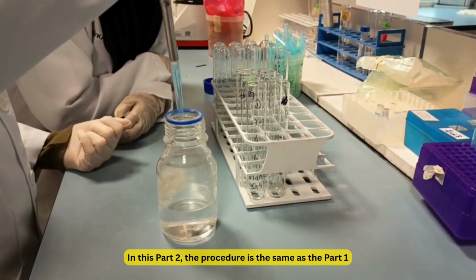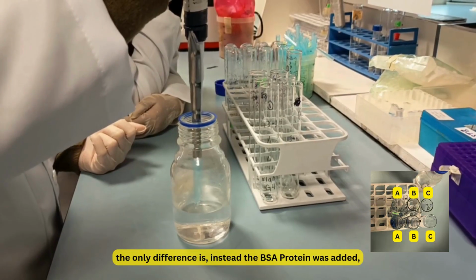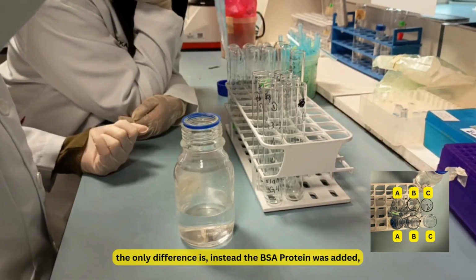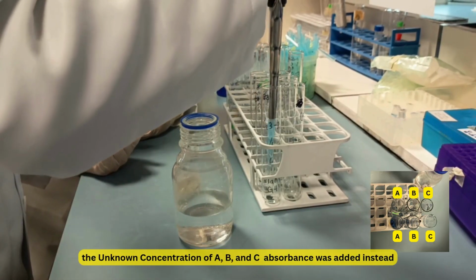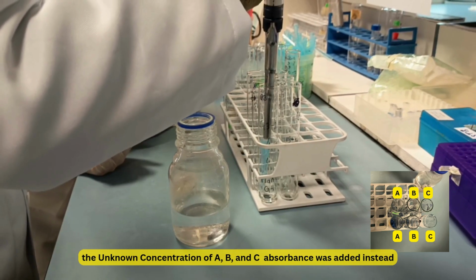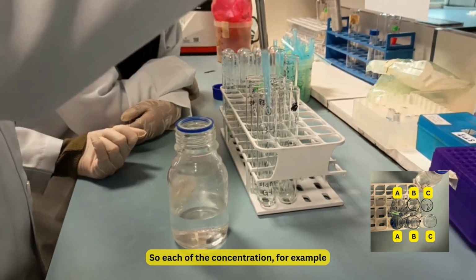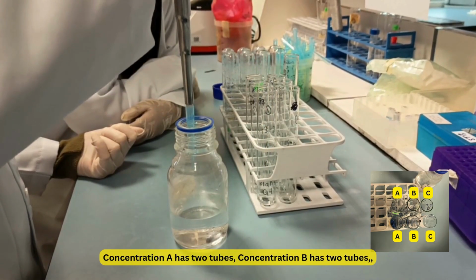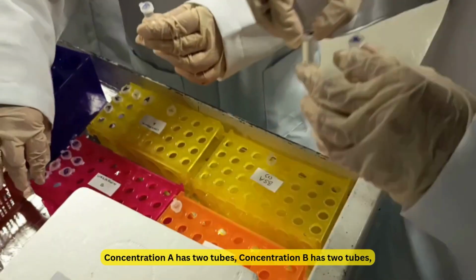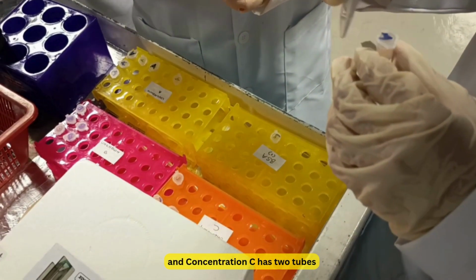In this part 2, the procedure is the same as part 1, but the only difference is that instead of the BSA protein, the unknown protein concentrations A, B, and C were added. So each of the concentrations, for example concentration A has 2 tubes, concentration B has 2 tubes, and concentration C has 2 tubes.